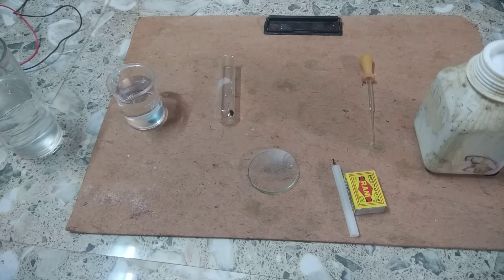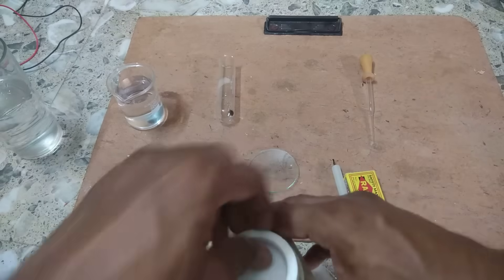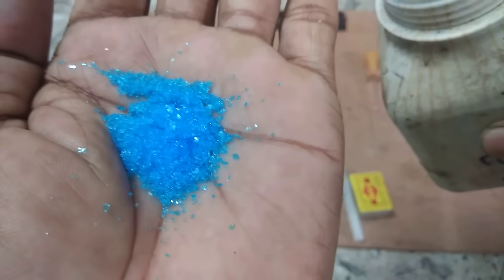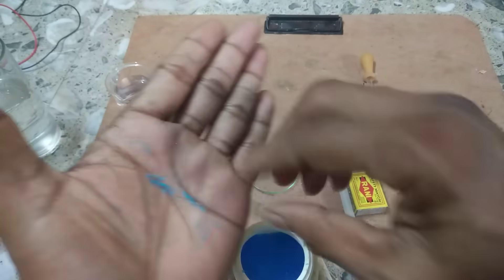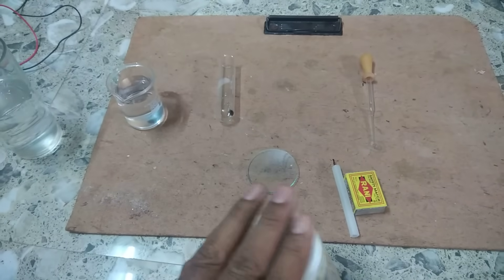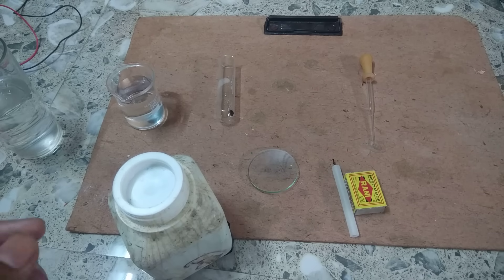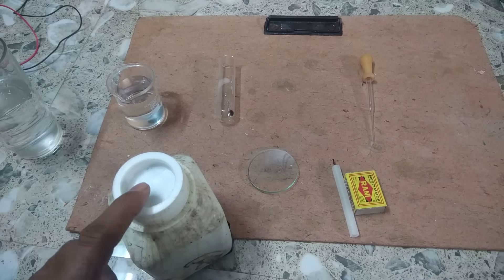Hello everyone, today I will show you an experiment with copper sulphate. Right here you can see these are the crystals of copper sulphate. The formula for these crystals is CuSO4·5H2O, that means 5 moles of water of crystallization.